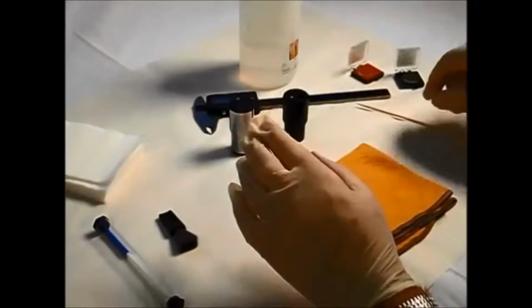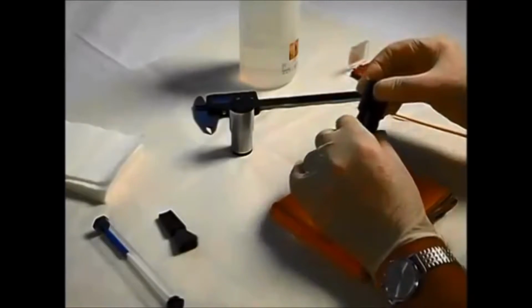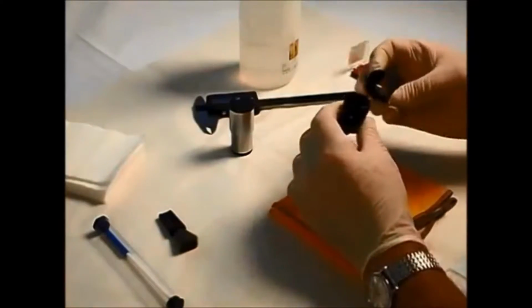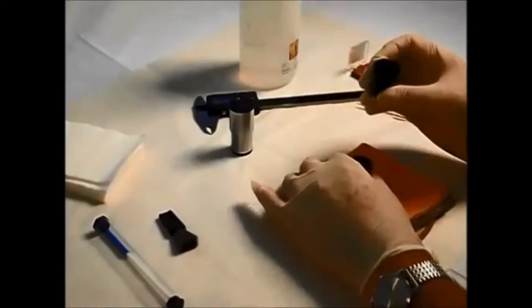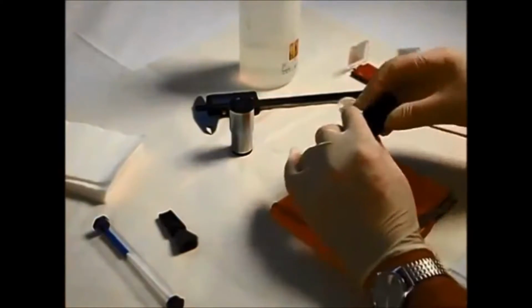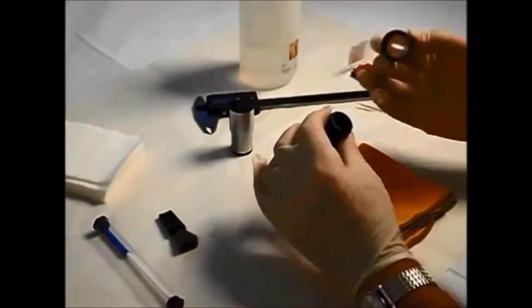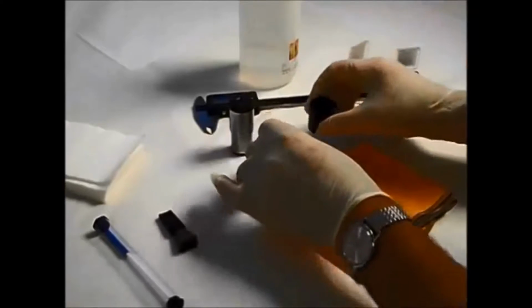Now, one of the most common causes of contamination comes actually from the eyepiece itself. When you unscrew an eyepiece assembly like this, you can get small fragments of the black coating come free and they fall inside the actual eyepiece. Now, when you reassemble, this later falls down onto the eyepiece reticule. This debris is now trapped inside the completed assembly and it can't be removed. Even if it's slightly out of focus, this can be a nuisance. So remember, do clean the eyepiece components once disassembled.